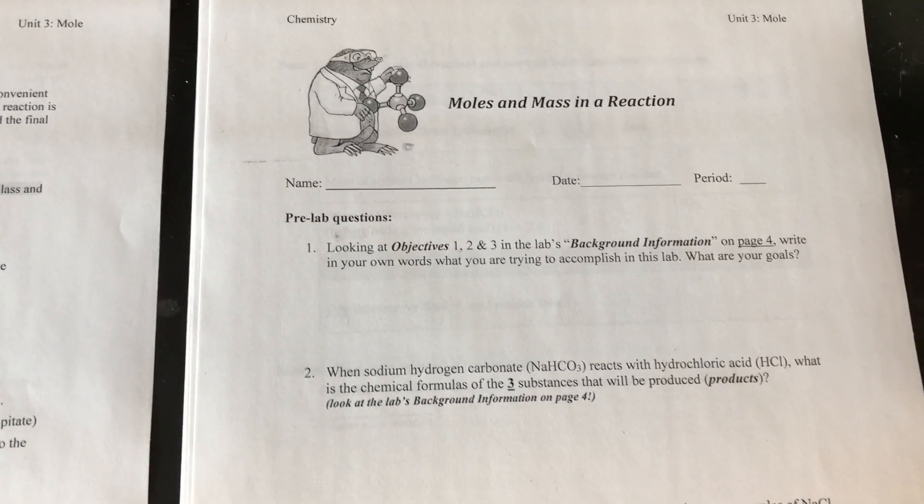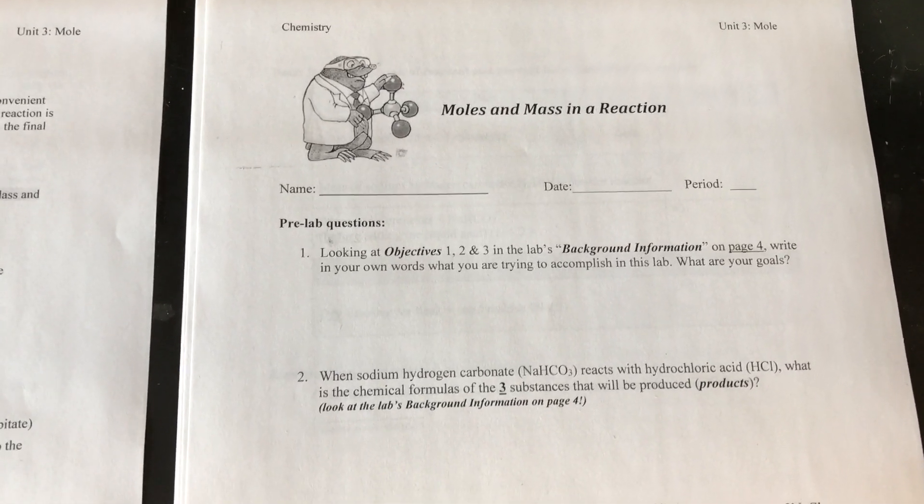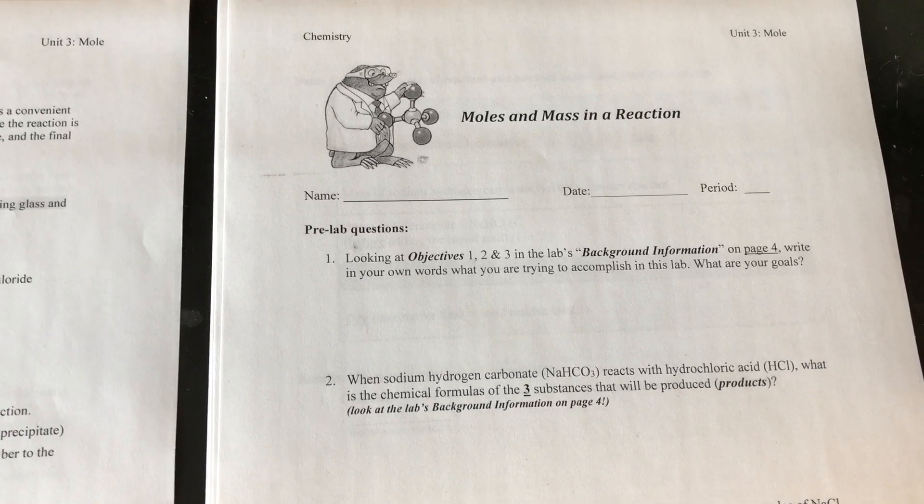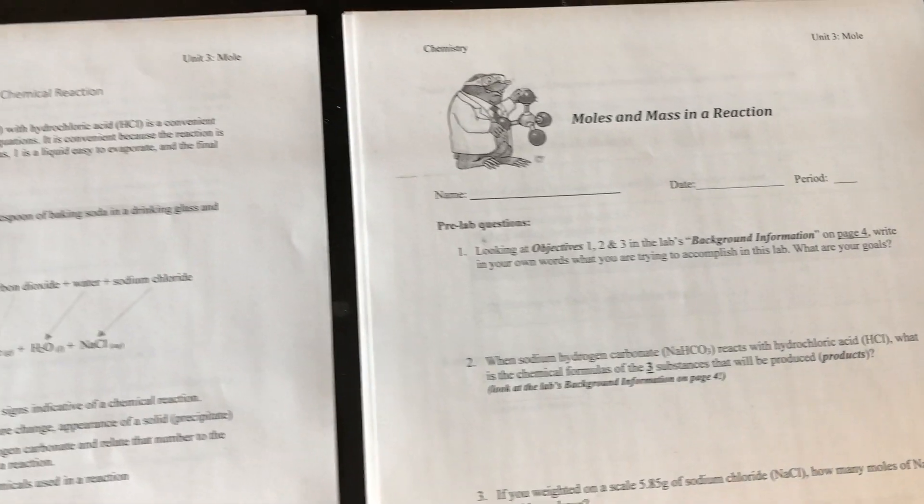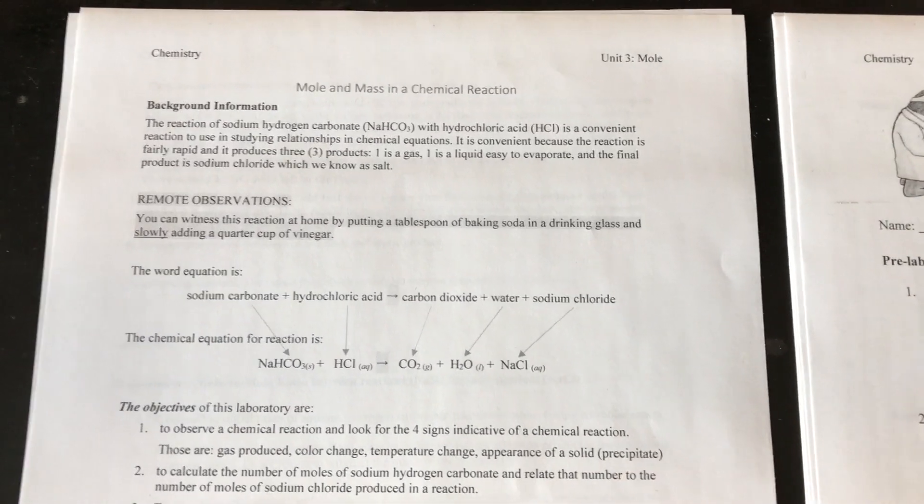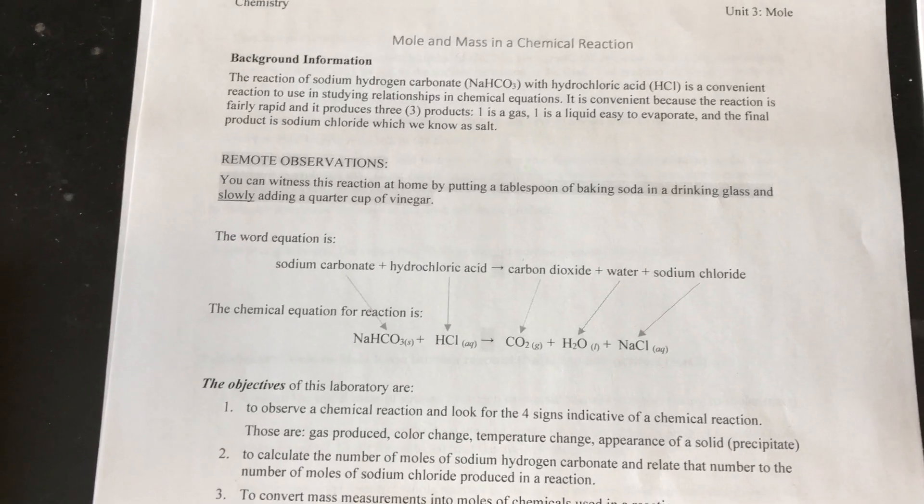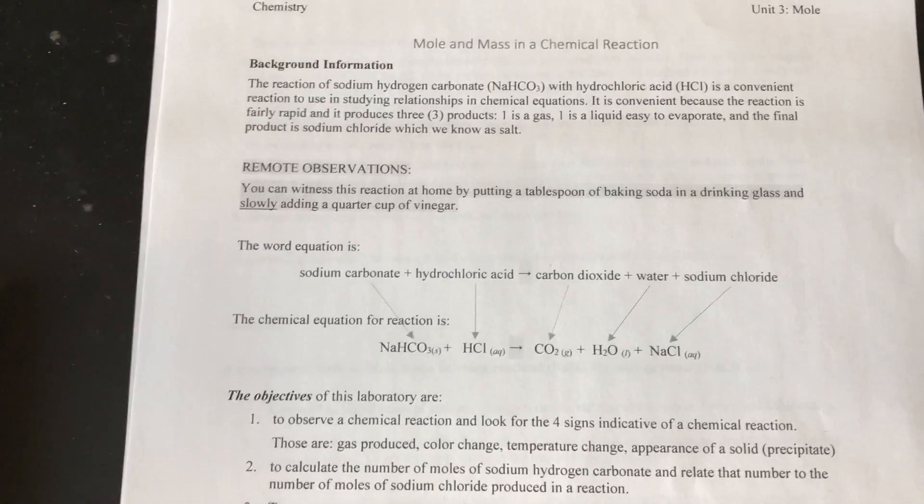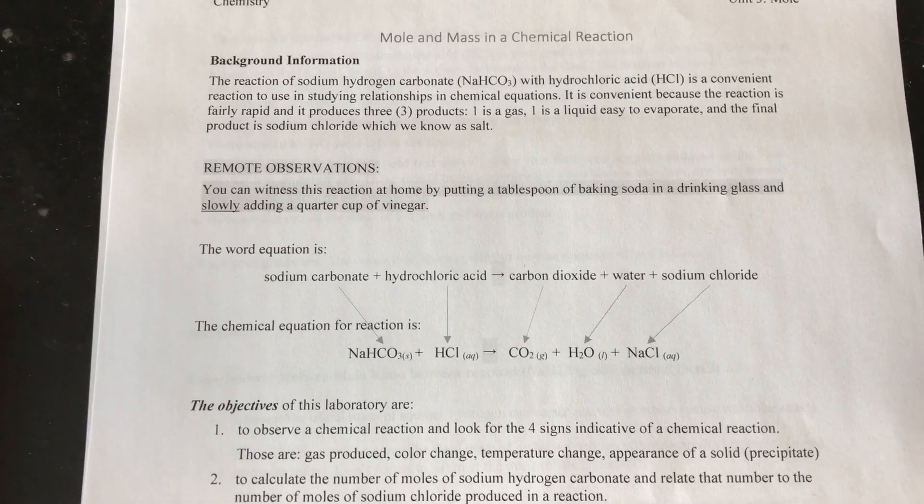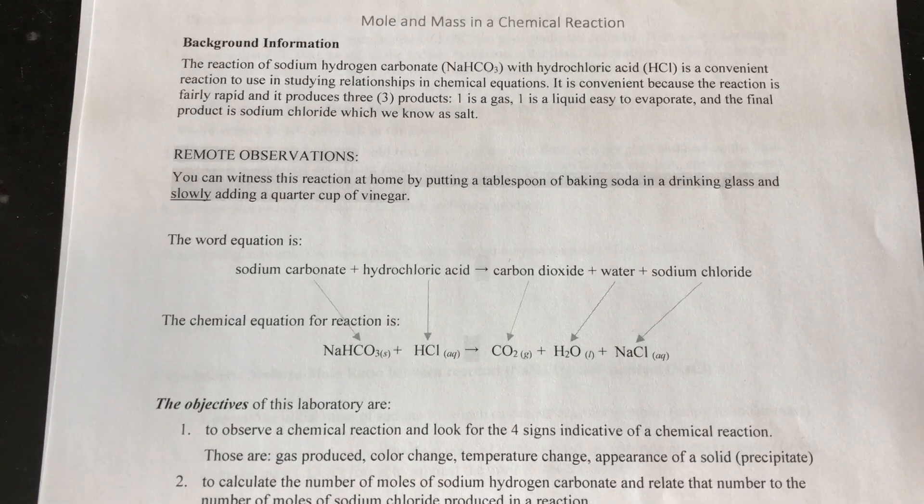This follows our lessons on how to balance chemical equations and how to calculate the number of moles from a certain mass of chemicals. Today we're going to apply all of that information we've gained over the past two weeks into a practical chemical reaction.